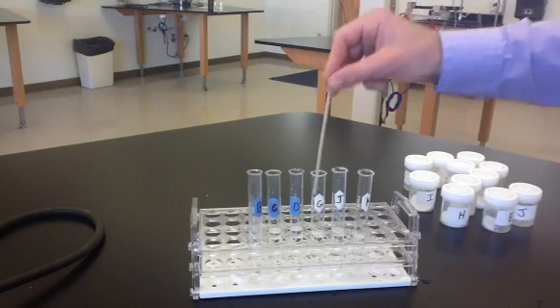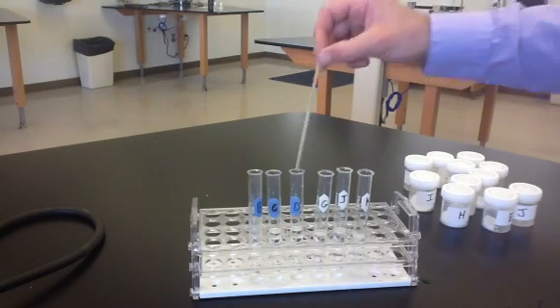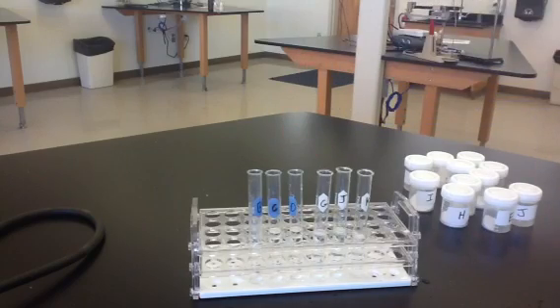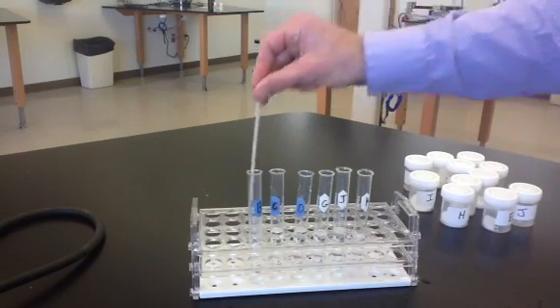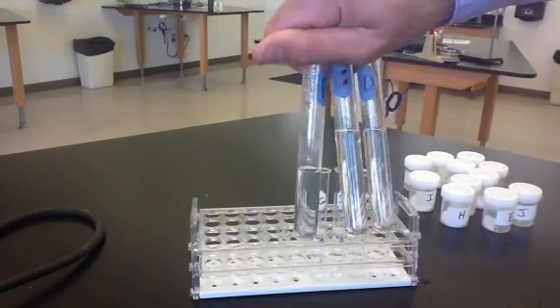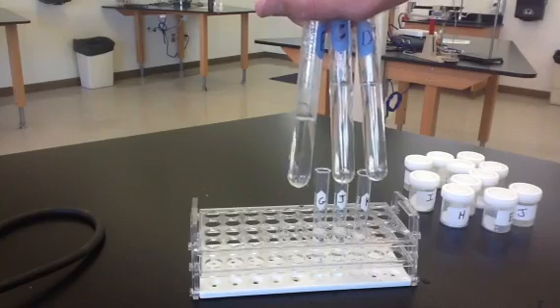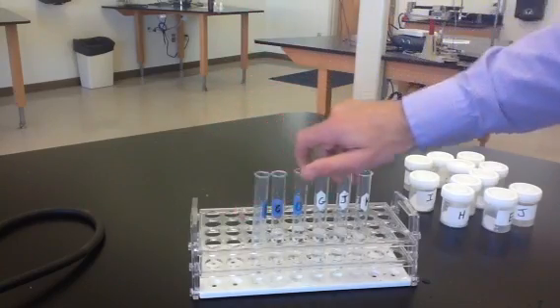So a precipitate reaction is when a solid is formed, so you'll see the solution becoming cloudy if you have a precipitate forming in any of these. So let's take a look. So here we have B, C, and D. They look like they all have remained clear, so that's no reaction, no precipitate formed in any of those cases.